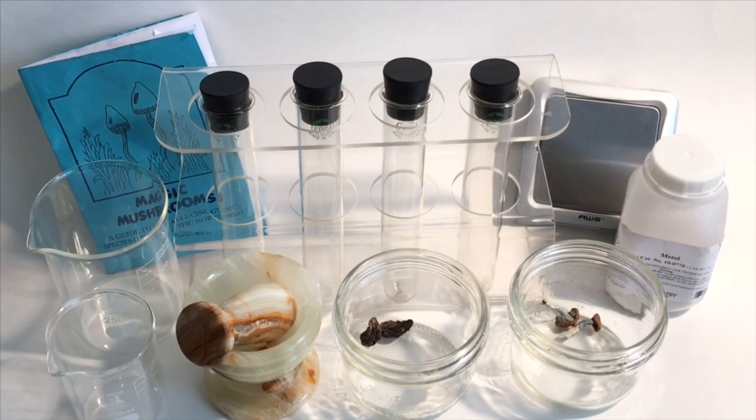I have a scientific experiment set up here. I know this is a bit of a departure from my normal esoteric and alchemical content.